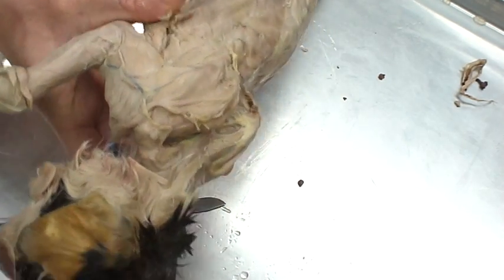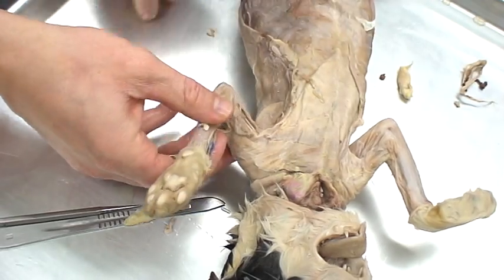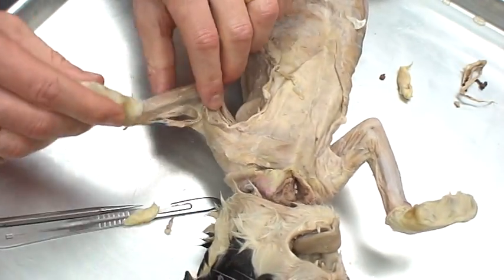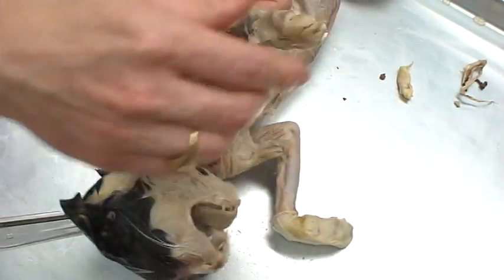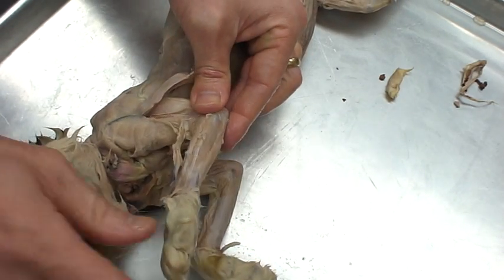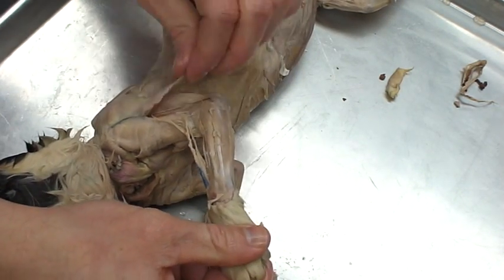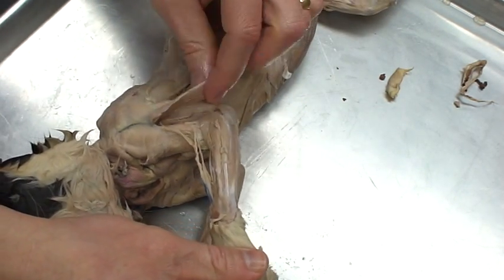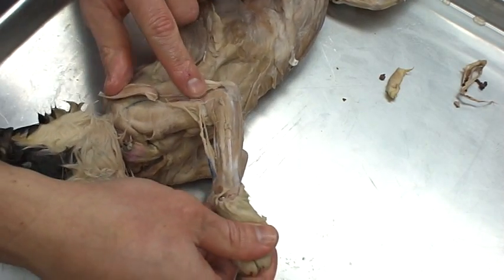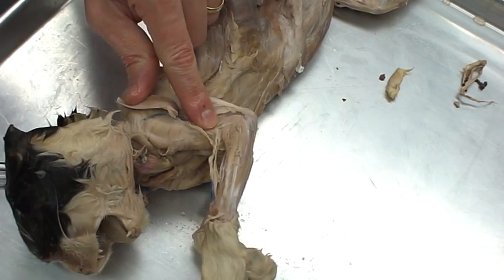Remember how we saw the biceps brachii — we had to pull inside. Now switching to this arm, looking at the lateral side of the cat, what we're going to see are the upper arm muscles. I reflected a tricep and we saw right here the brachialis muscle.